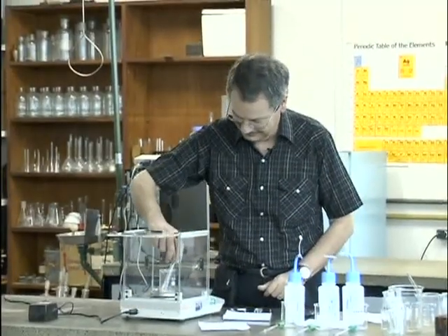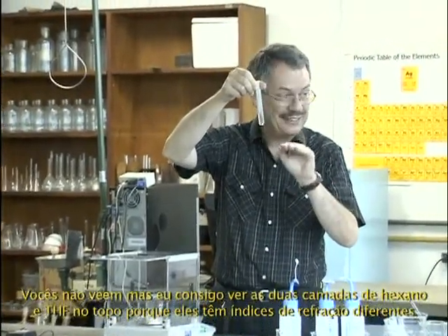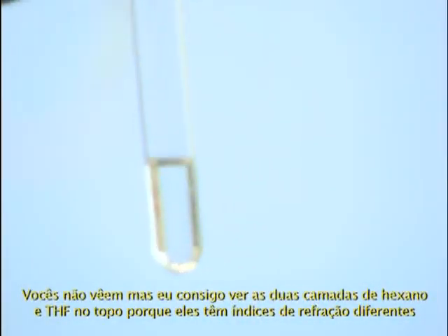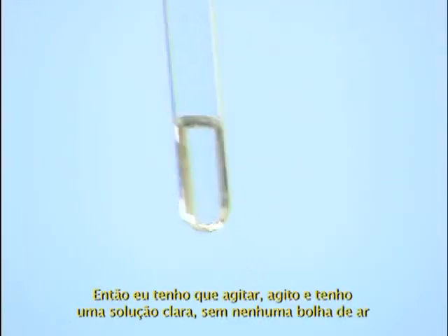You don't see it, but I can see the two layers of THF and hexane at the top, because they have a different refractive index. I don't know if it shows on the movie, but I see it by eye. So I have to shake.